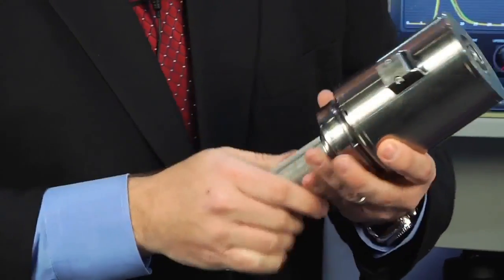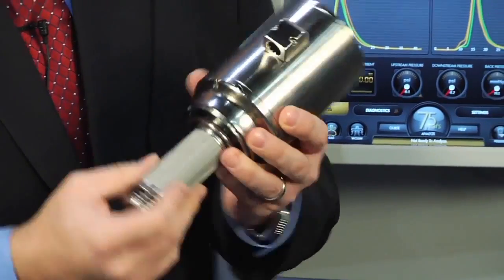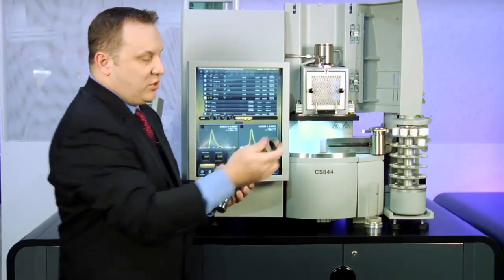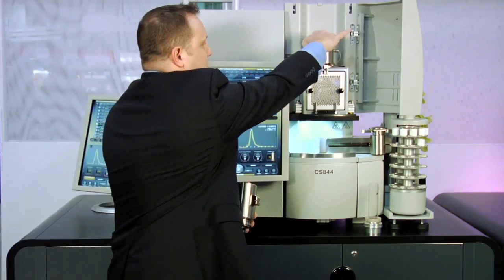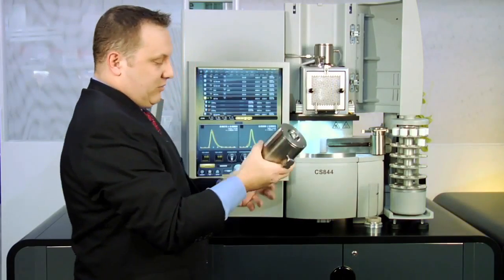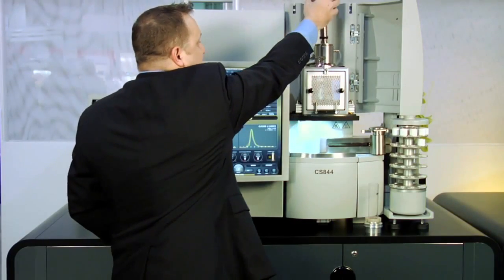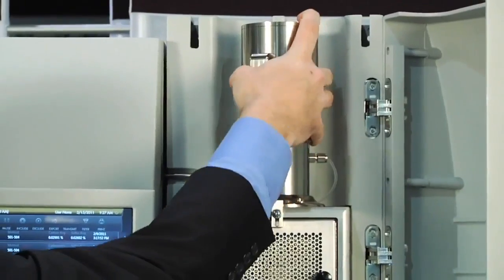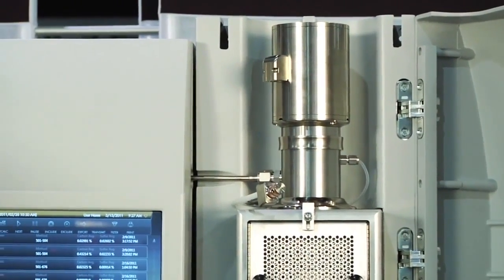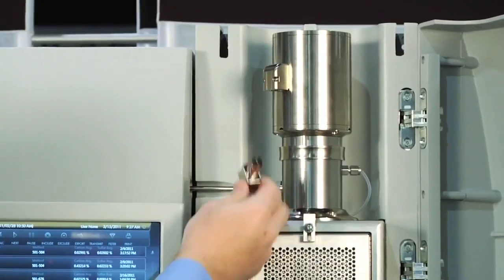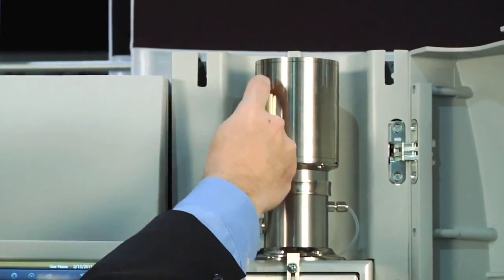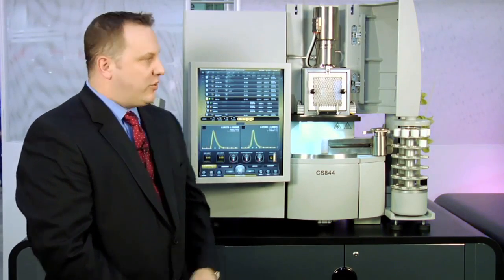To replace the auto cleaner, there are no tools required and I simply replace the dust filter, place the auto cleaner back into the furnace and with a single turn I can put it back into the furnace and reconnect the pneumatic gases. This system is also equipped with our optional 60 position shuttle loader.